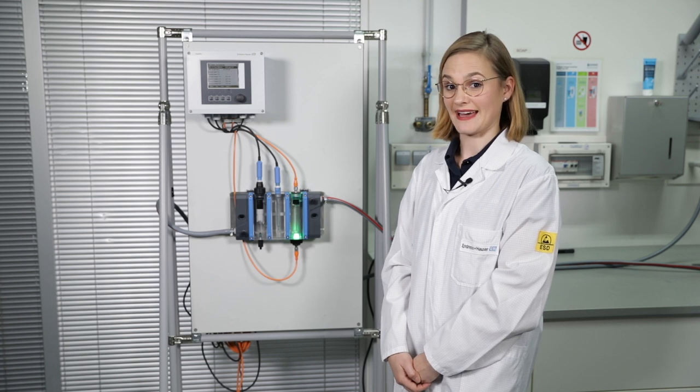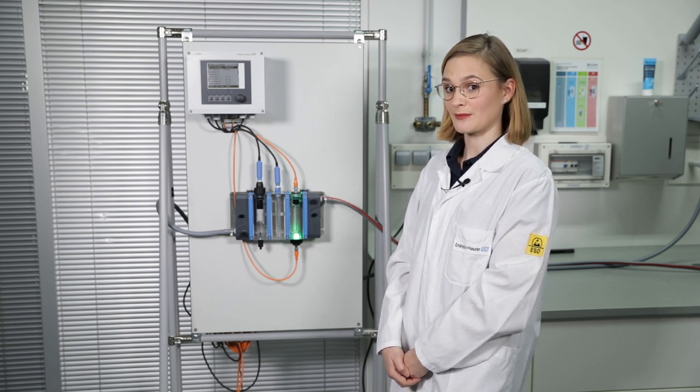So now everything is set up. Before you leave the measuring point, please make a function check.